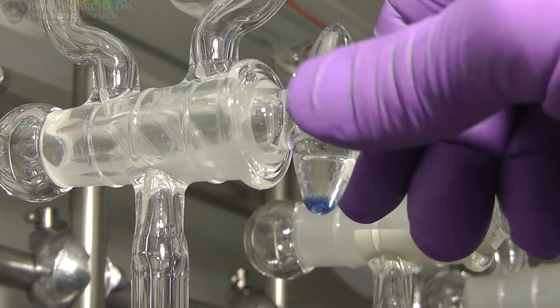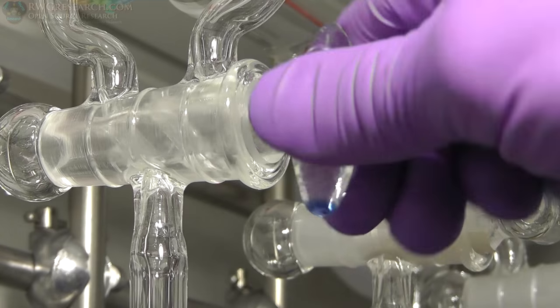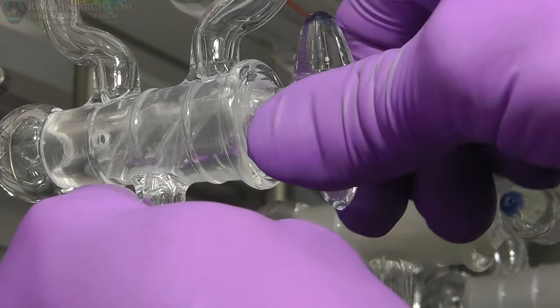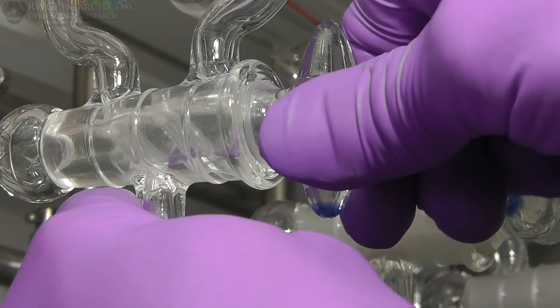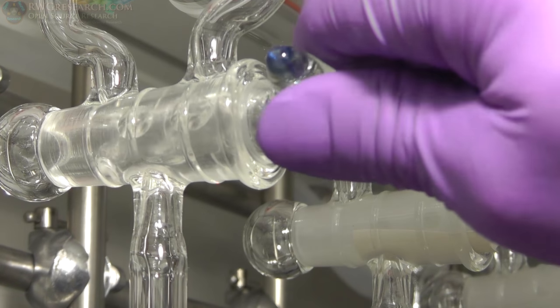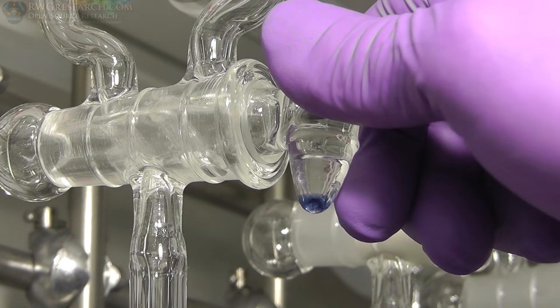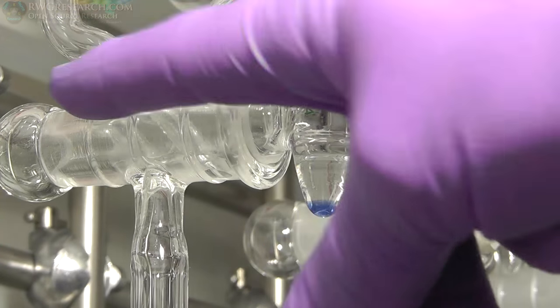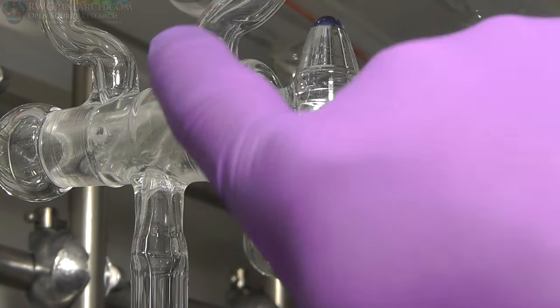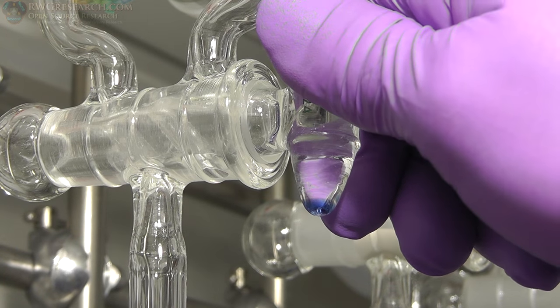So push it in slowly. You can see how it cleared up. Now we're going to turn it. Try to work out all that air. And hopefully that's good enough. So as you can totally see now, you can see the path of which way those pipes connect. So with this down, this pipe connects to the outlet. And with this up, this pipe connects to the inlet. So one's vac and one's your incoming gas. That's it. That's how this stuff seals.